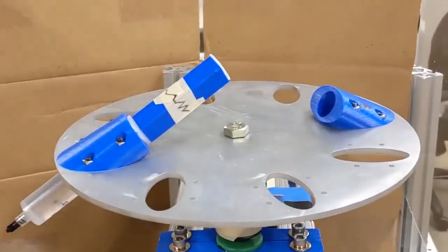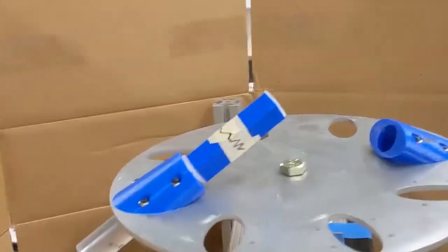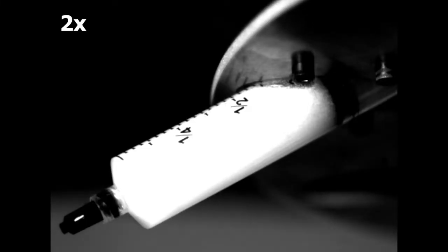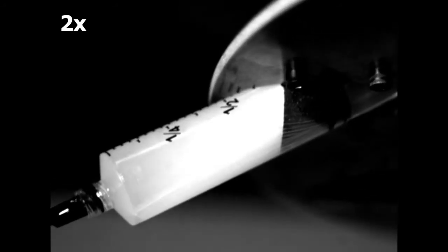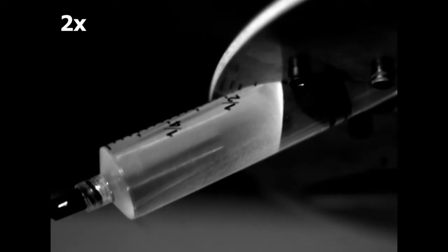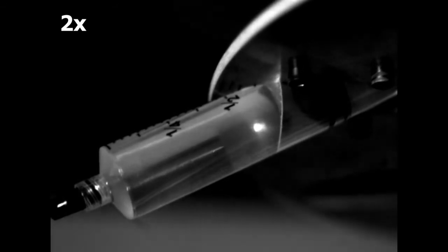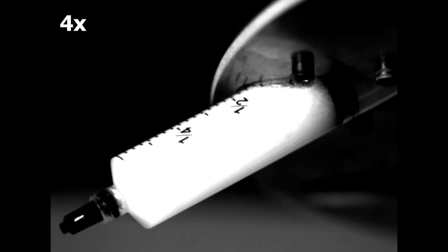Okay, voiceover Fernando here. You probably want to see how they look, so let's look at the view from the high-speed camera. The syringe here has a lot of bubbles, and we made this on purpose so it looks a little bit more impressive. But you can see that the video clearly shows how the centrifuge works. This is actually accelerated, I think 2x, so it's not too fast. But as you can see, it's just extremely effective.